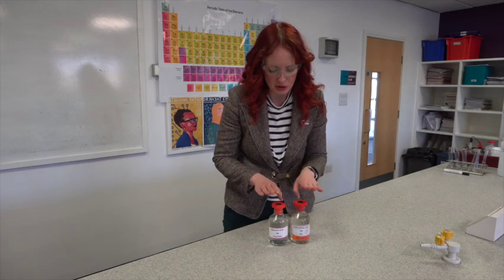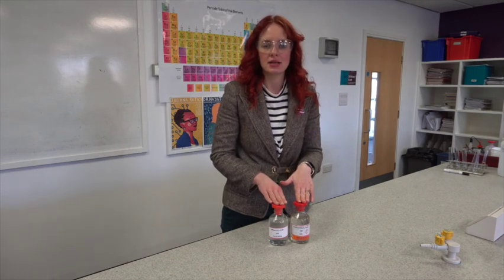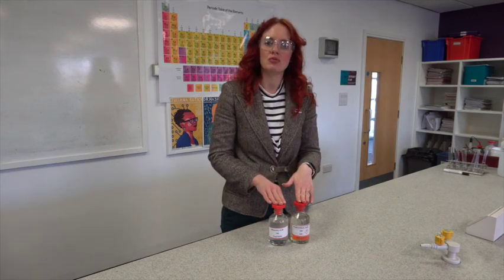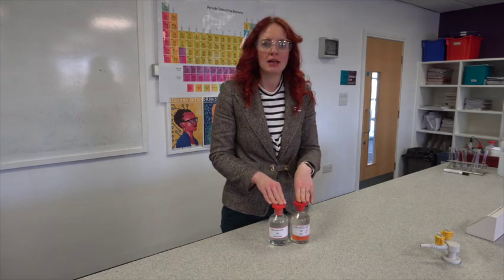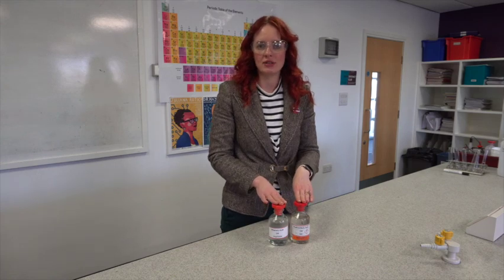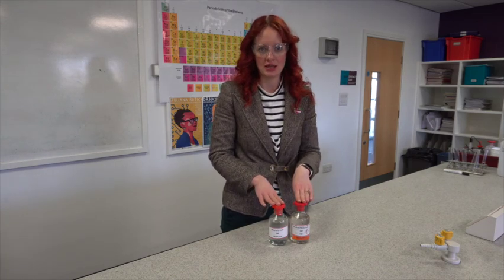We're going to be looking at the reactions between these two acids and carbonates. We're going to react them with magnesium and we're also going to have a look at the difference in pH using a pH probe.